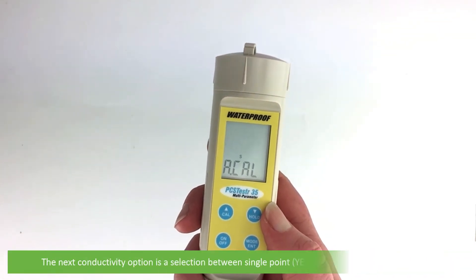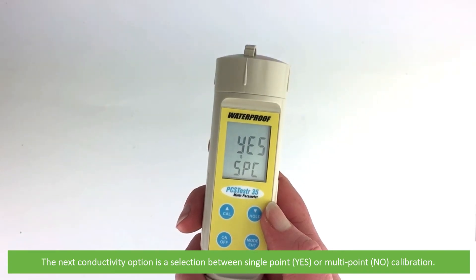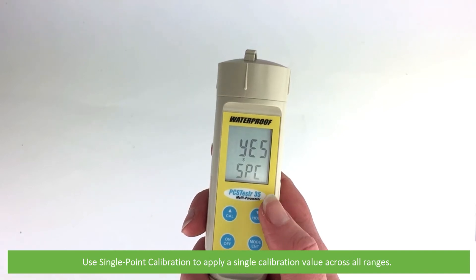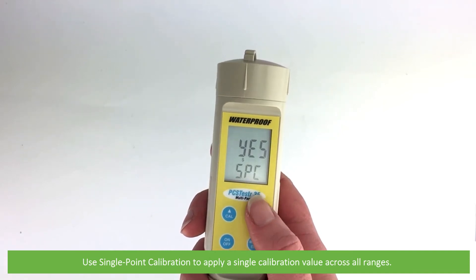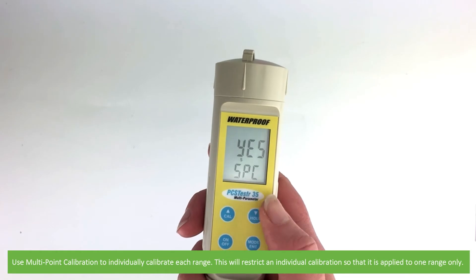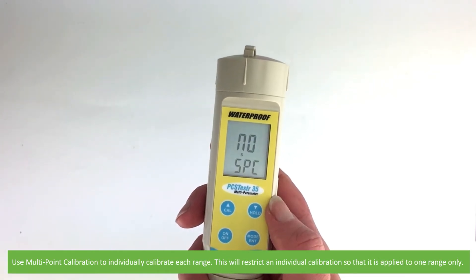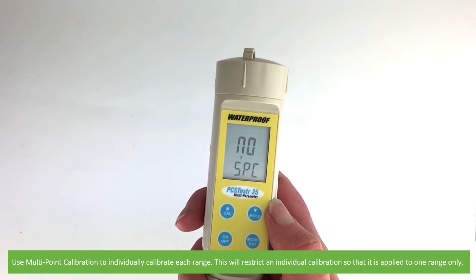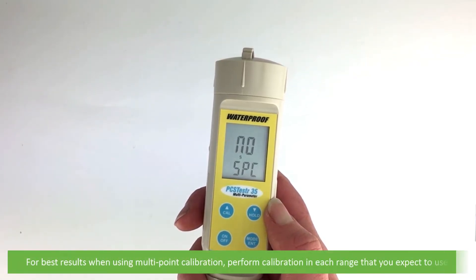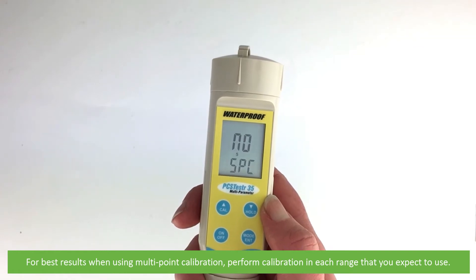The next conductivity option is a selection between single point or multi-point calibration. Use single point calibration to apply a single calibration value across all of the ranges. Use multi-point calibration to individually calibrate each range — this will restrict individual calibration so that it is applied to one range only. For best results when using multi-point calibration, perform calibration in each range that you expect to use.